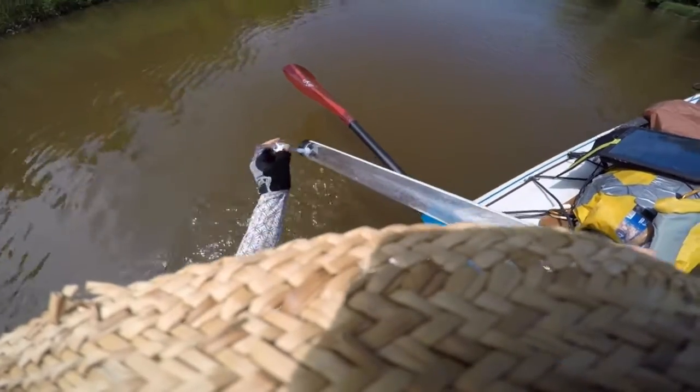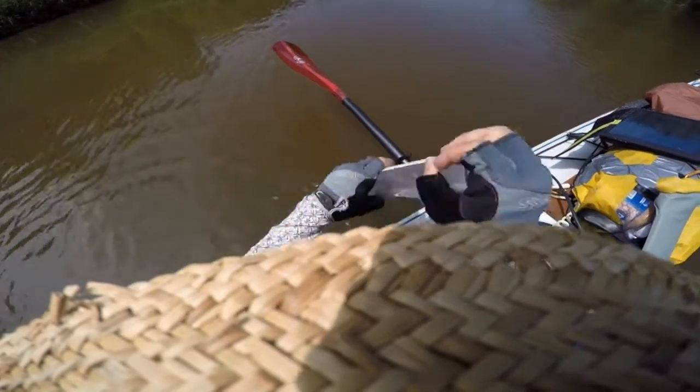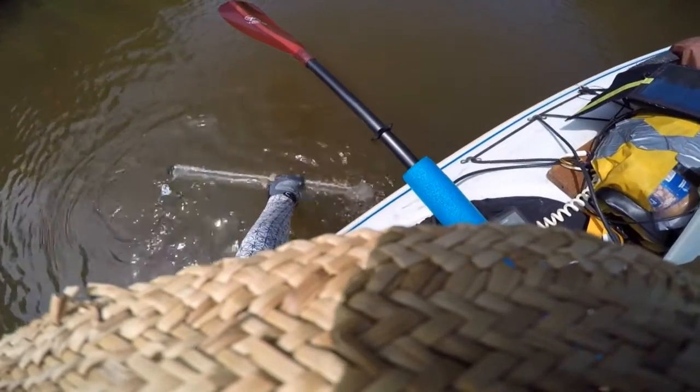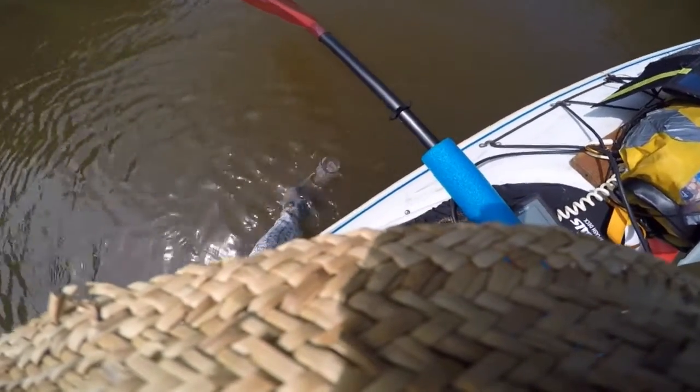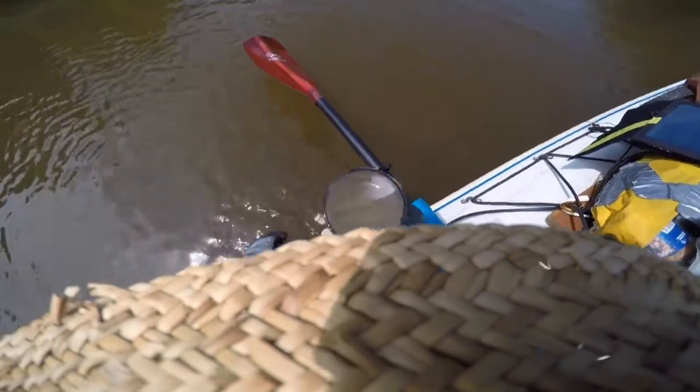With the tube, you block this off so that it's pinched so no water can go out. You fill it up all the way. Then I look and let out water until I can see the disc again. Right about there — I don't know if you can see it or not, it's very faint, but you can sort of see the effects of the white and the black.